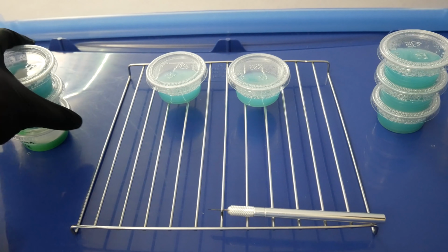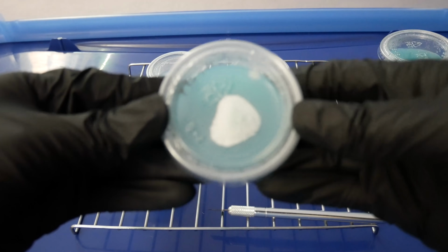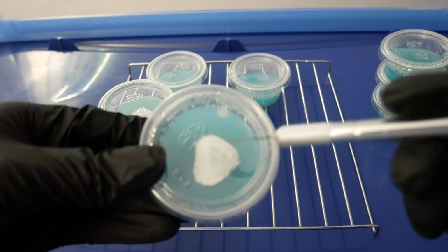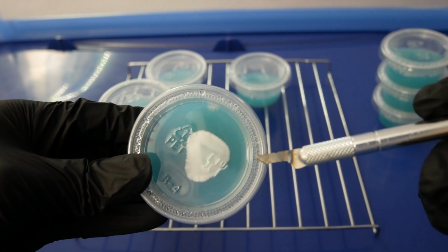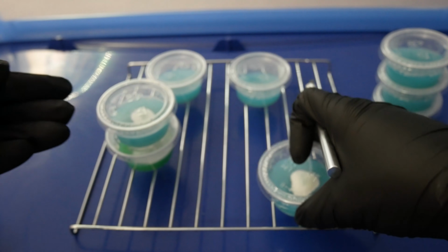We're back again in class, and today we're going to go over transferring mycelium on agar, what to look for, what to avoid, and why it's important. I'll be showing you guys here three plates that I'll be cleaning up. This one here's got a little bit of an odd growth in the top corner here, and we'll go ahead and transfer the clean culture away from that.